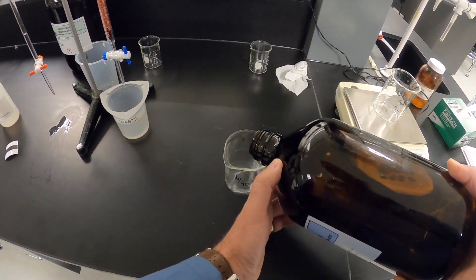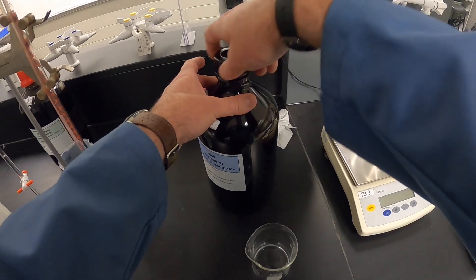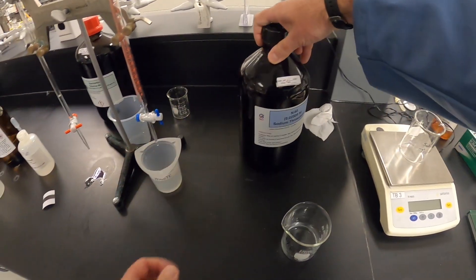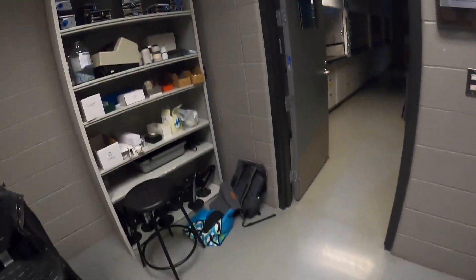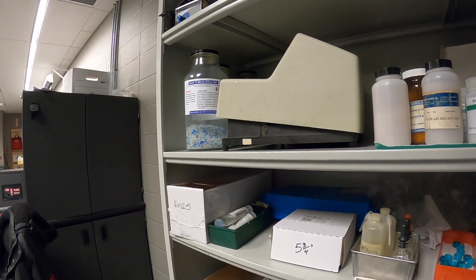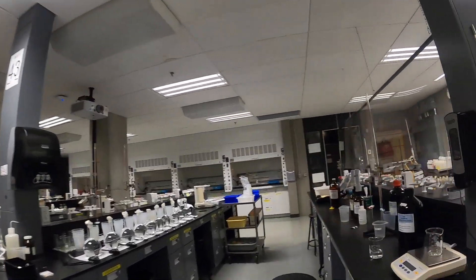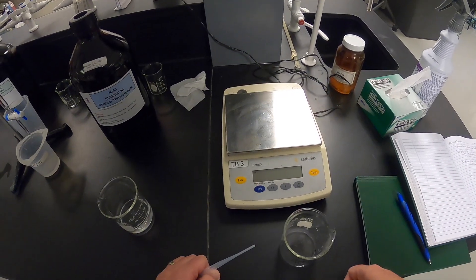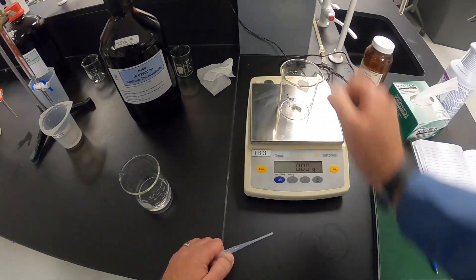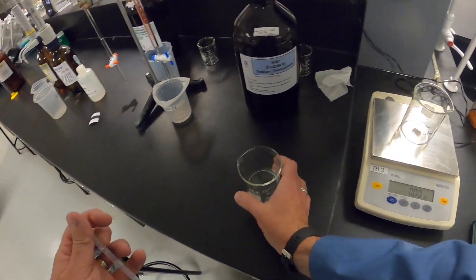The reason I'm putting this into a beaker first is to allow me to more accurately ensure that 10 grams is added to the diluted beaker. We turn on the balance, tare our beaker, and we're going to add 10 grams.